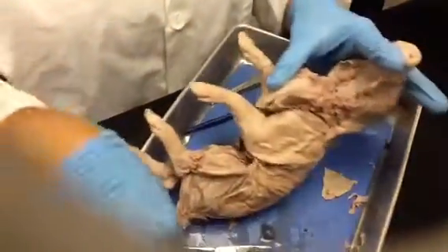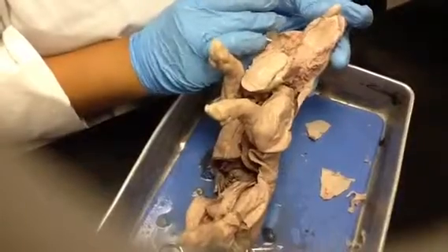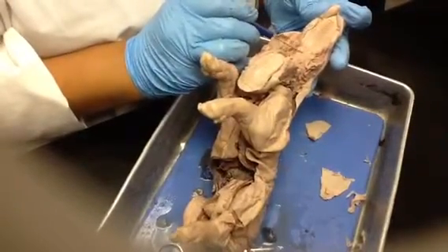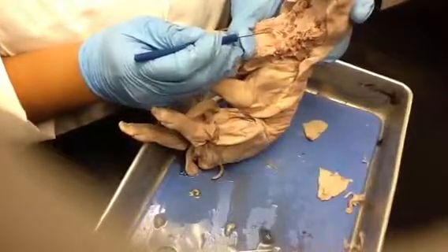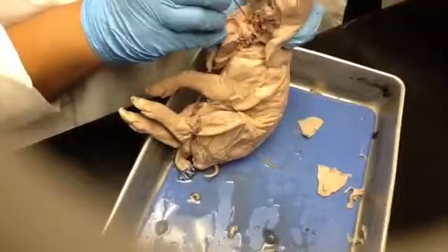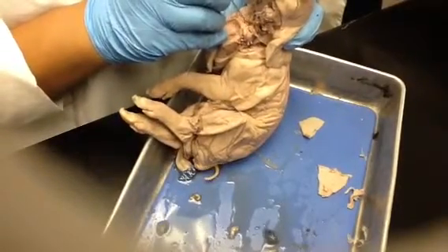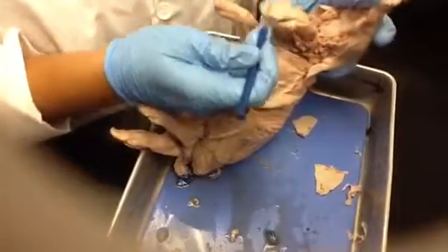Okay, so just to point out a few structures. You see the roof of his mouth, right? The palate, hard palate and soft palate. The epiglottis, which I think I may have mentioned last time. This is the opening to the nasopharynx. Right here you have the laryngopharynx, and then right there the esophagus is right beyond that. Obviously the tongue, you can see some of the papillae on the tongue.